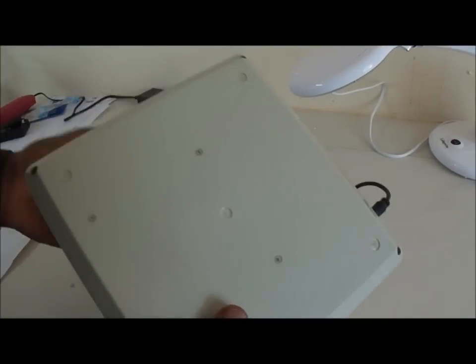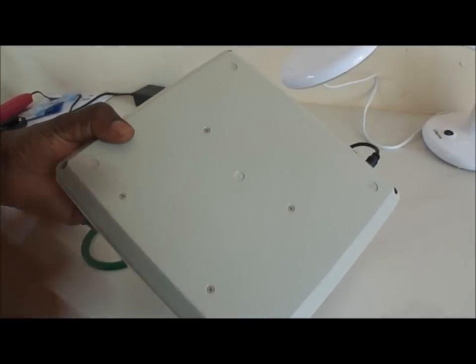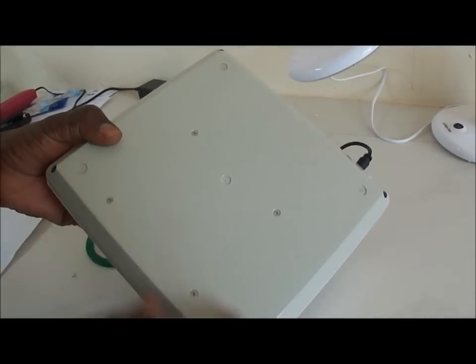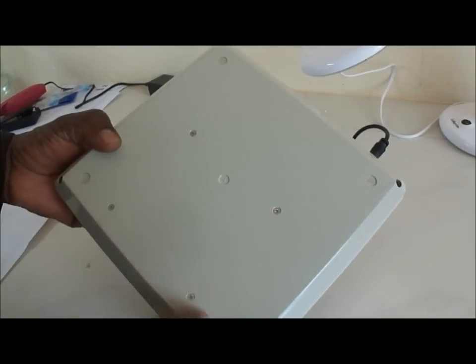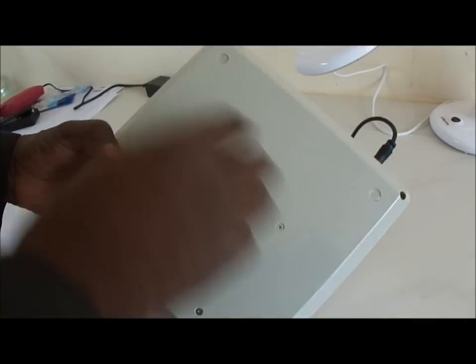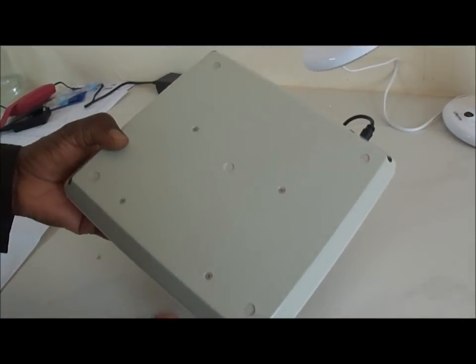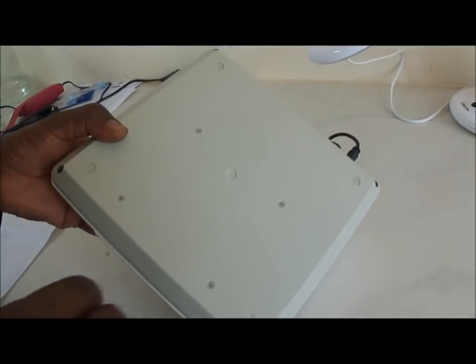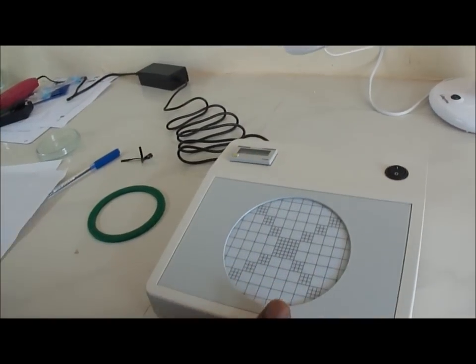At the back you have four screws, if you remove this screw, four screws in the middle here and four other here, if you remove this cover you will find a battery. This battery can be replaced easily by ordering them.